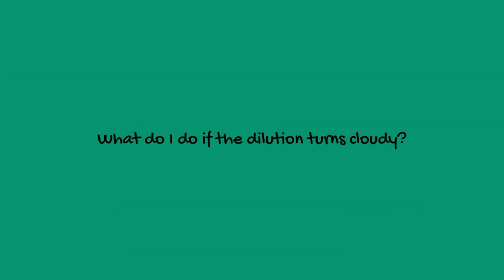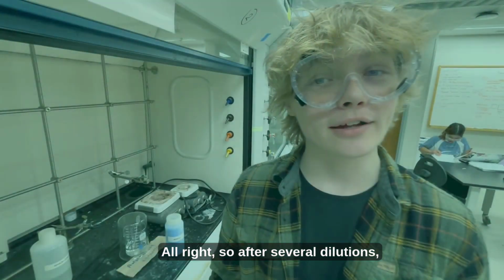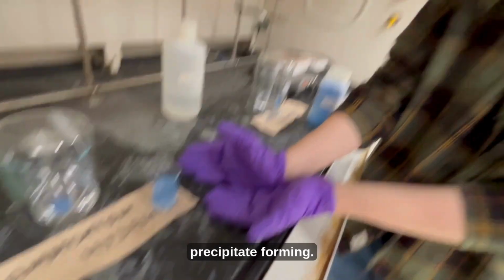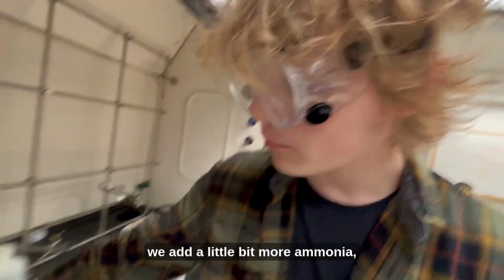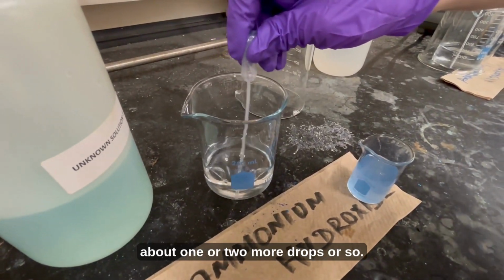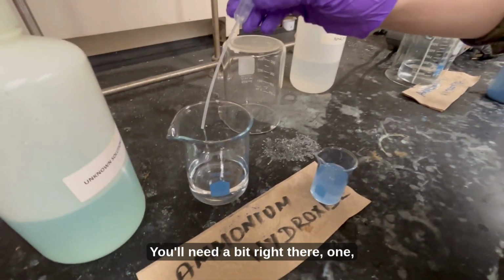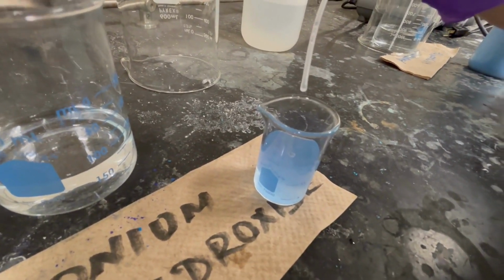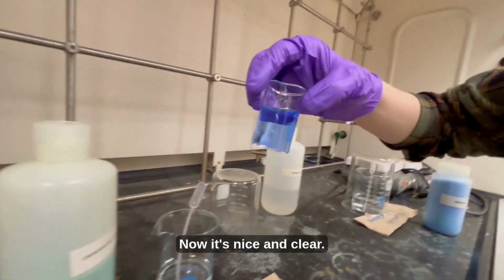What do I do if the dilution turns cloudy? Alright, so after several dilutions, you can risk having a cloudy precipitate forming. So to counteract that, we add a little bit more ammonia, about 1 or 2 more drops or so. So get a little bit right there, and then 1, 2. Now it's nice and clear.